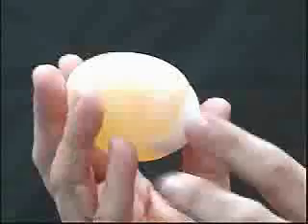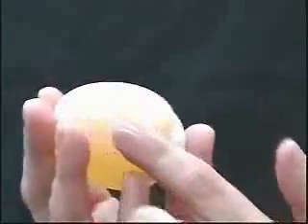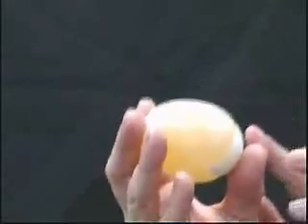Dr. Pope showed you how to process the egg so that the shell will be dissolved. And this you should do with 2 eggs simultaneously. It will take a total of about 3 days for the shell to fully dissolve, and then what you will get is an egg similar to this one, where you have seen that most of the shell has been dissolved. You can see in this egg the shell has mostly been dissolved except for at the 2 ends, which is convenient because it makes it easy to handle.